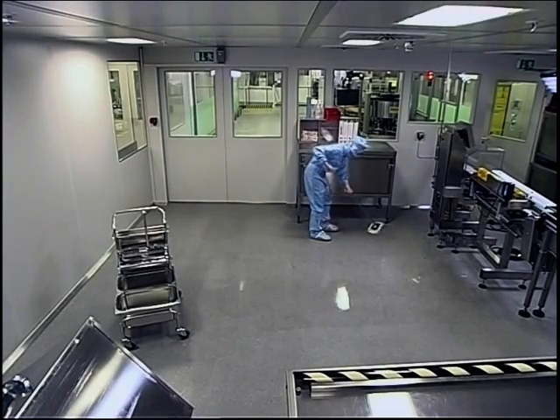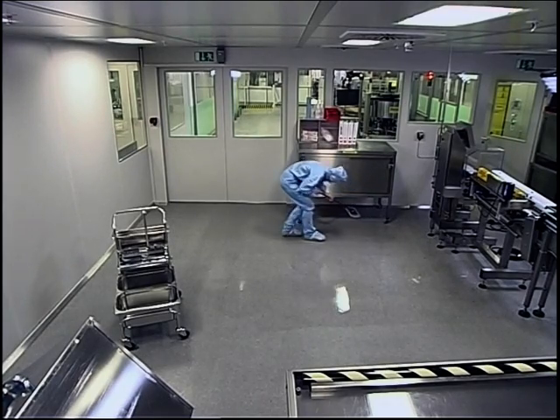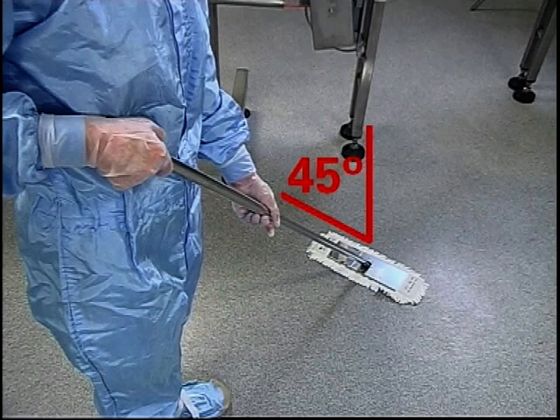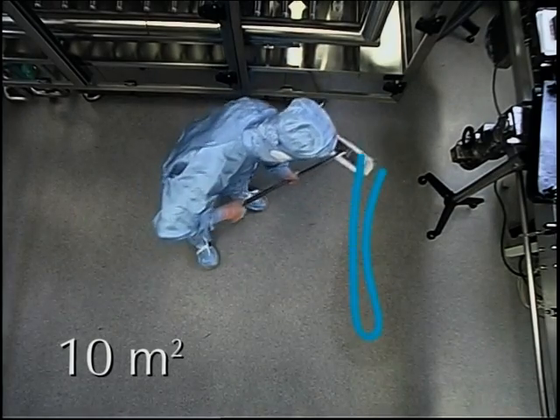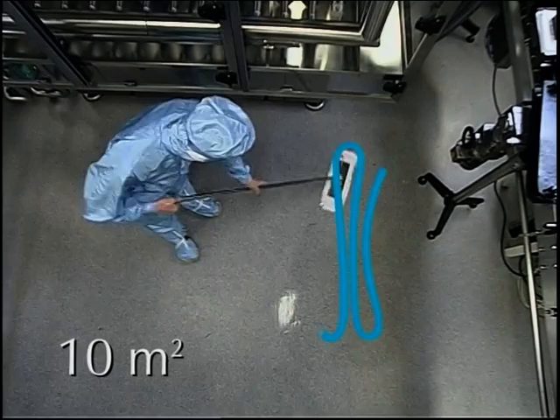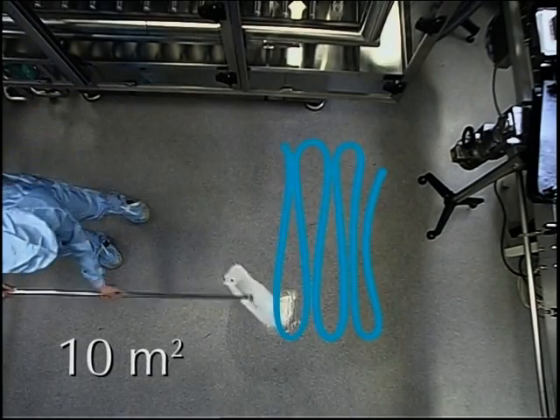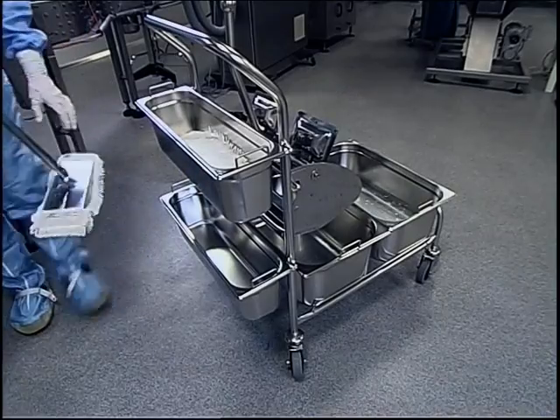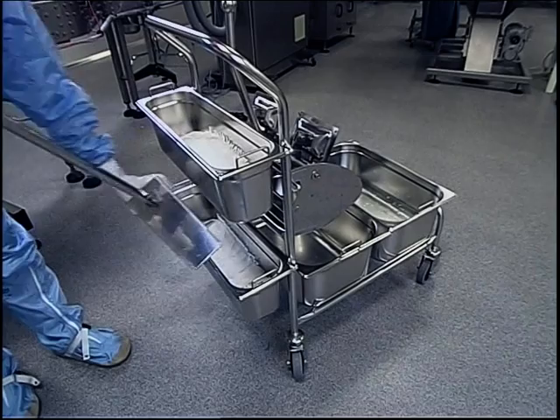Wipe carefully under furniture and equipment. Hold the mop handle properly in order to save energy. Like that. Hold loosely at an angle of about 45 degrees, then wipe in figure of 8 movements and, of course, make sure that the arrow is always pointing towards you while moving backwards. And if it gets more difficult, the mop is empty and must be replaced.